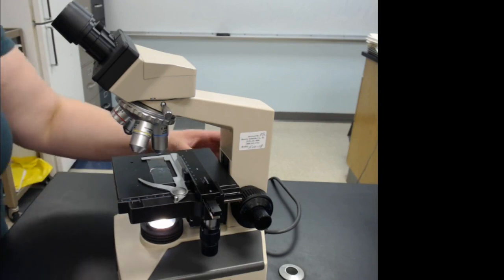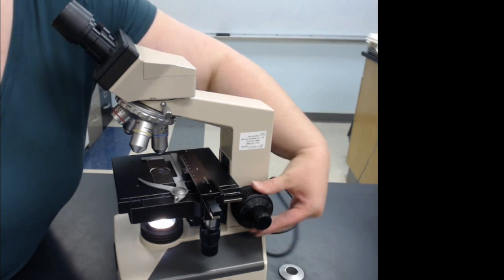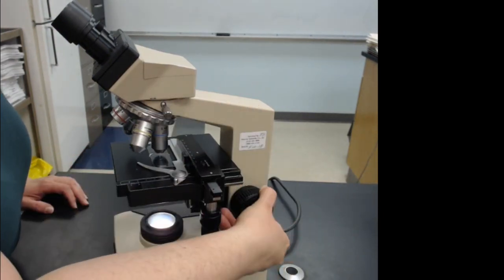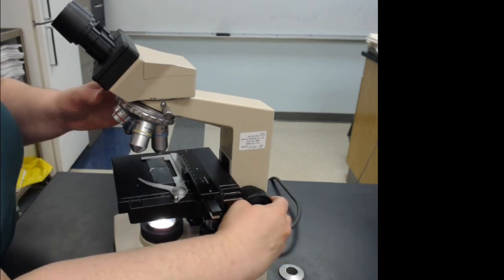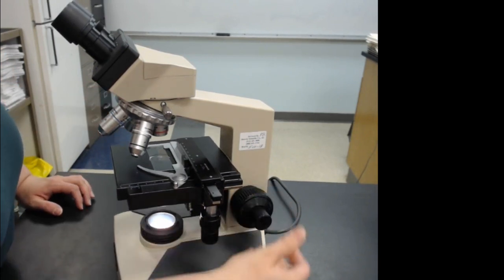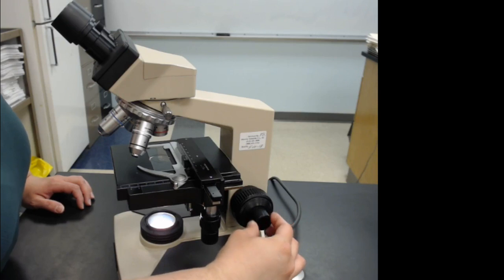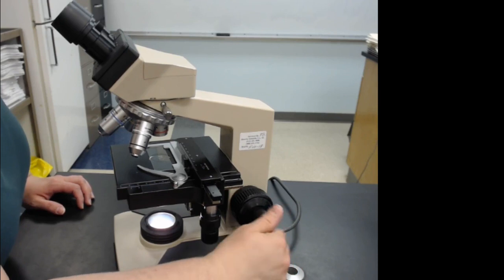To bring your specimen into focus you use the focus knobs. The coarse adjustment is the large knob on the inside nearest the arm — it moves the stage up and down. The fine focus knob is the small one and it moves the stage only tiny bits at a time, getting things really sharp. You'd have to move it for a really long time to significantly move the stage.